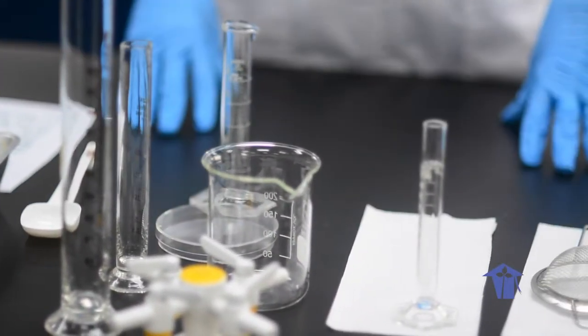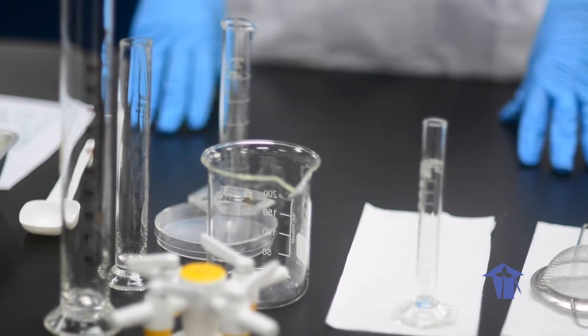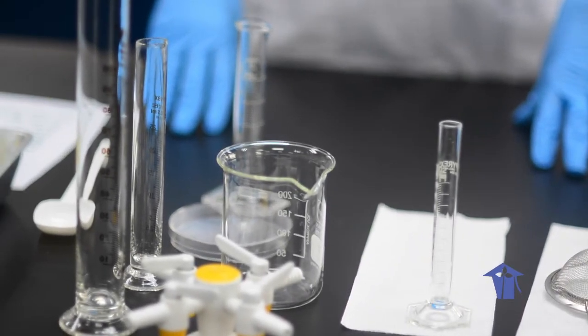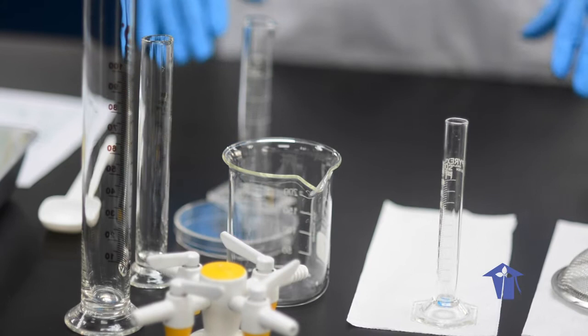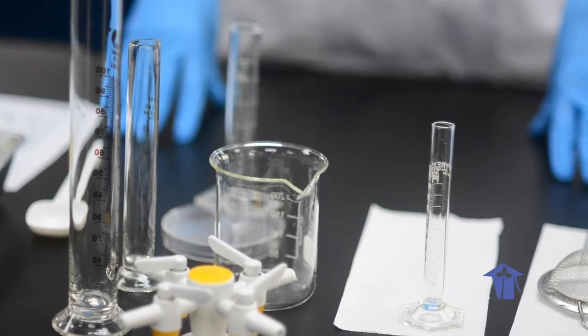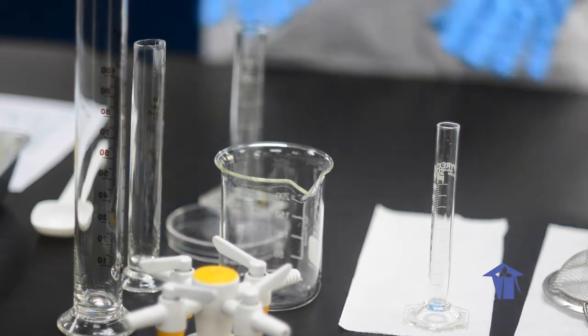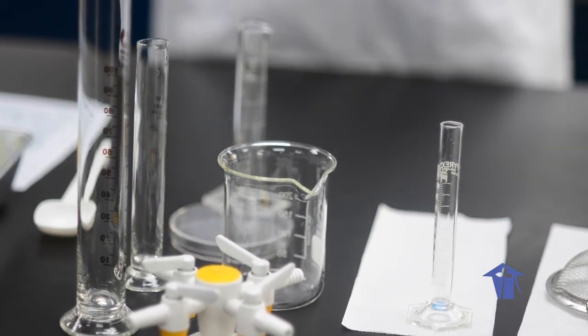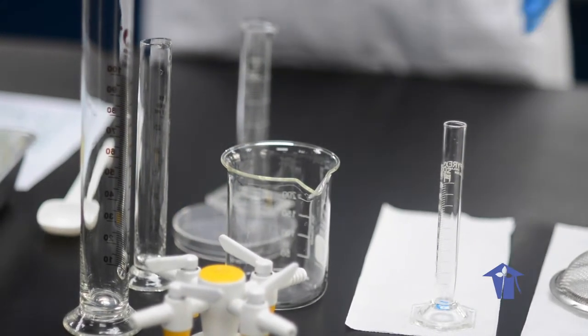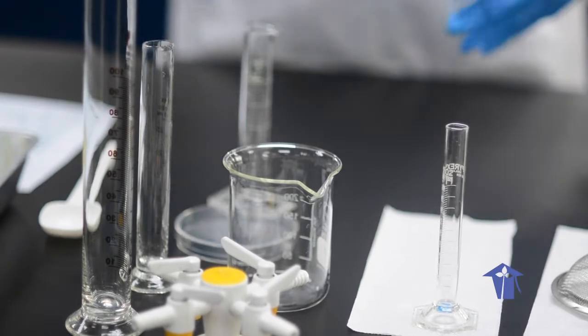This requires that you read through the instructions beforehand and make a list of all the required pieces of apparatus and materials, and then lay them out logically so that you can easily reach each one as that step comes.